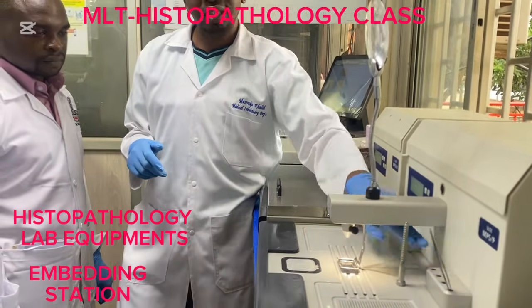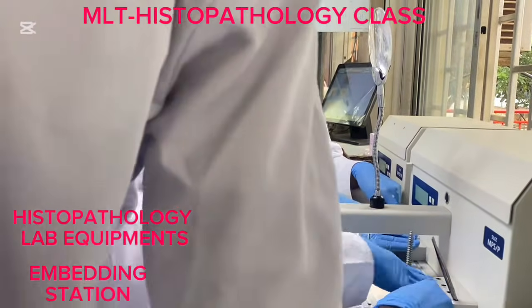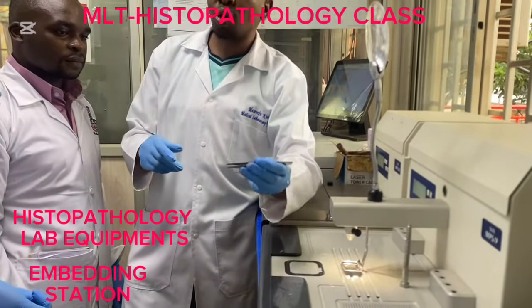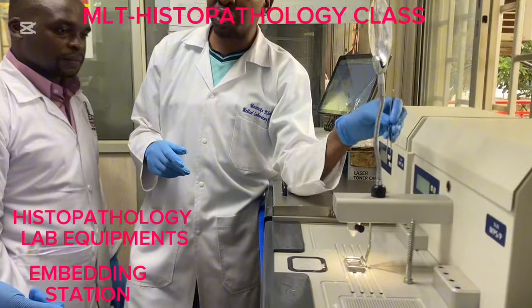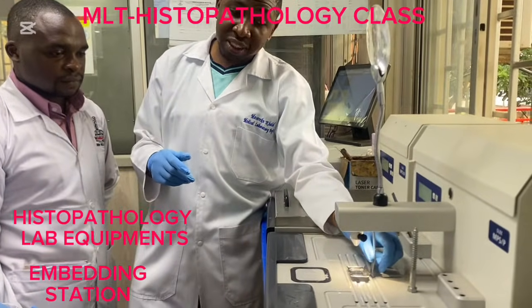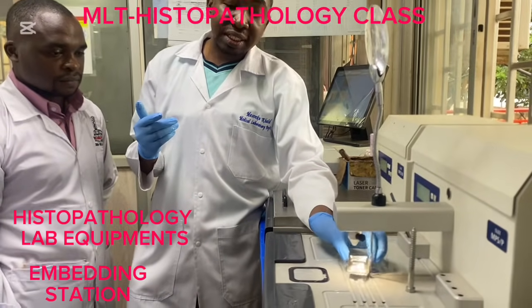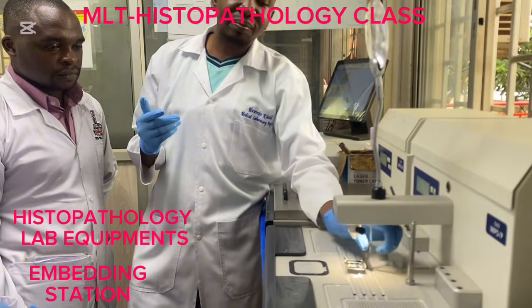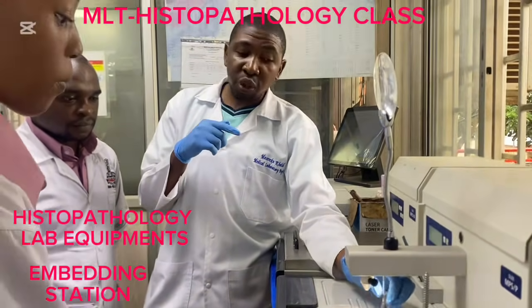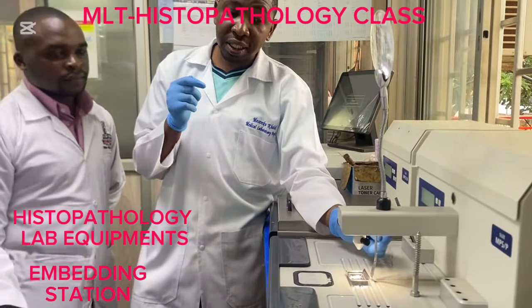We have a forceps compartment. Let's touch. Still it is warm. Why? We want to ensure that there is no solidification on the forceps we are going to use during embedding. Then we have paraffin wax dispenser or paraffin wax dispenser nozzle. So this nozzle is connected to the wax tank, okay, for continuous supply of paraffin wax into the embedding molds.